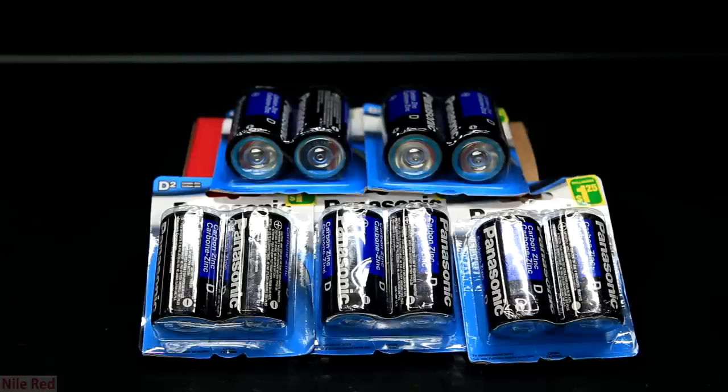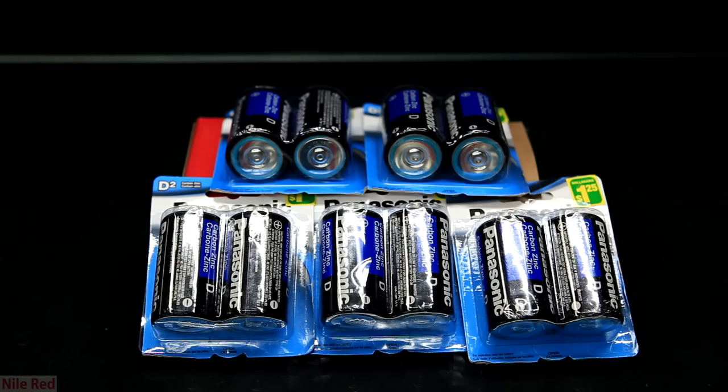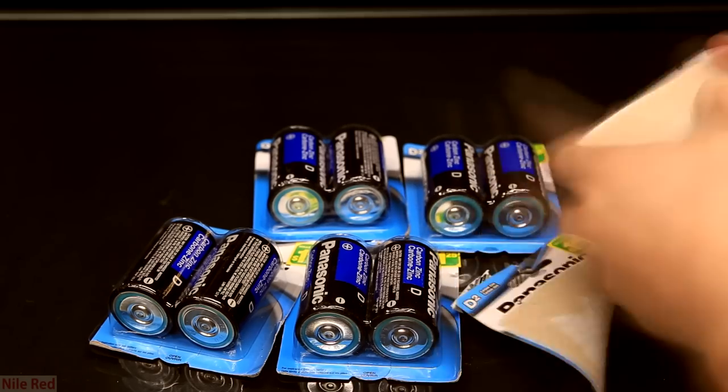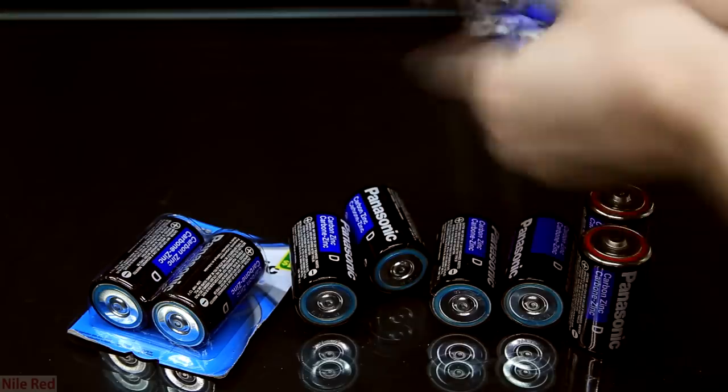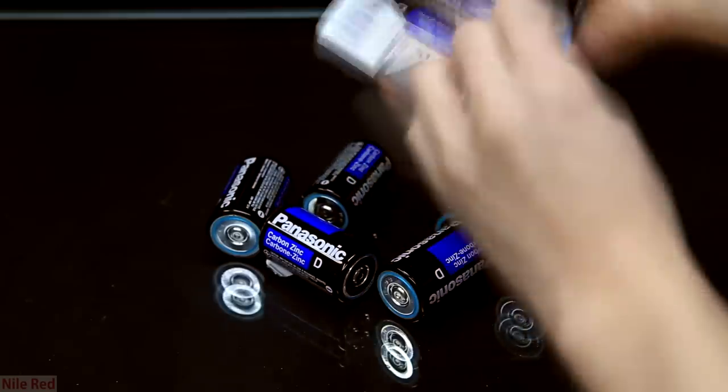If you had to do this process with double A's or triple A's I would just really feel bad for you. For the first and somewhat obvious step we need to take the batteries out of the packaging. I do this pretty quickly and then I just dump them all together on the table.